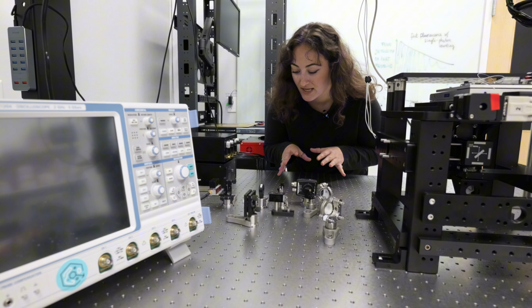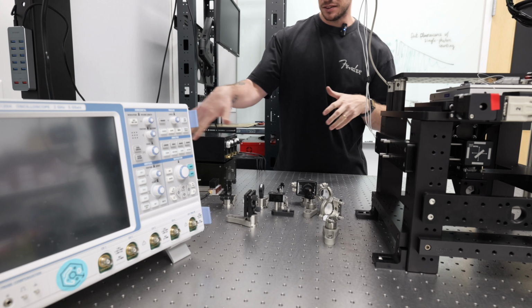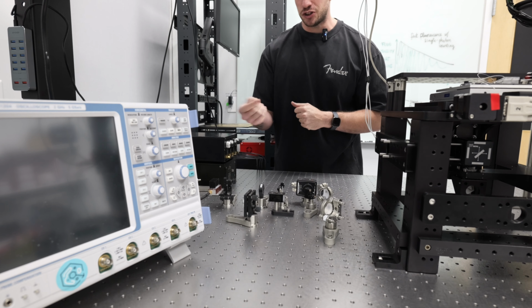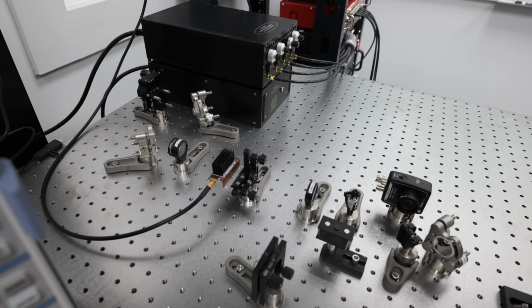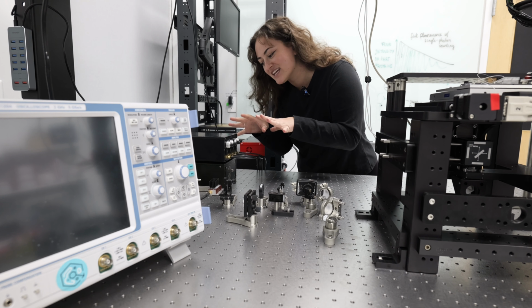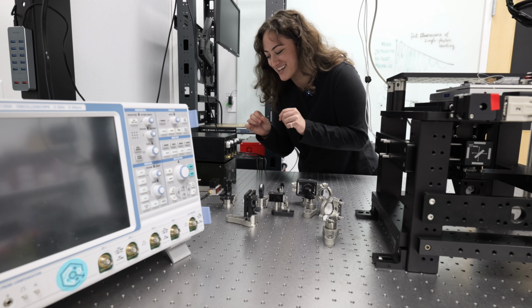They are lenses. This is an optical path with lenses and mirrors, like Kyra said, that can chop the laser light into tiny pulses. This is a laser. Pause. This is intense laser radiation.